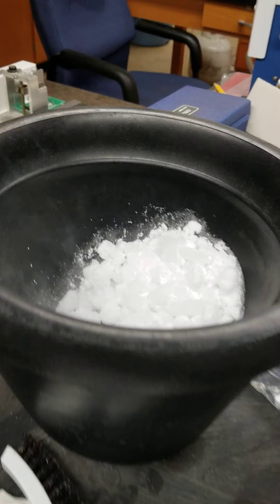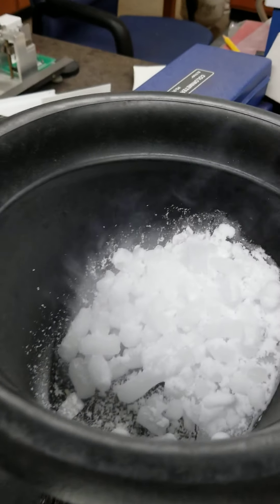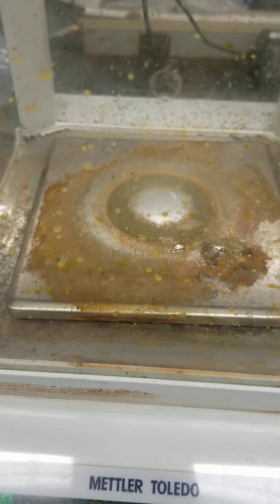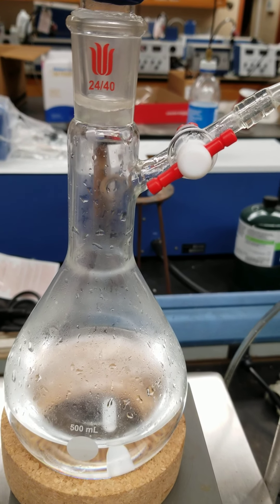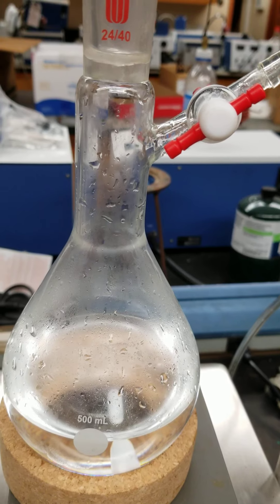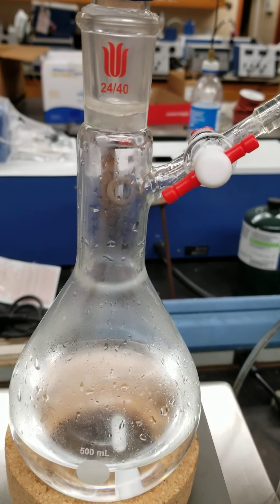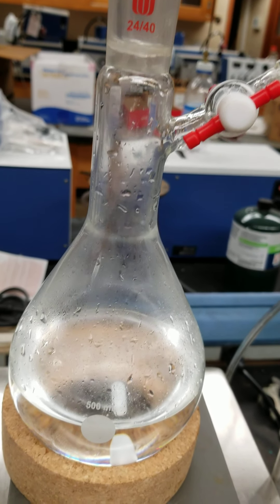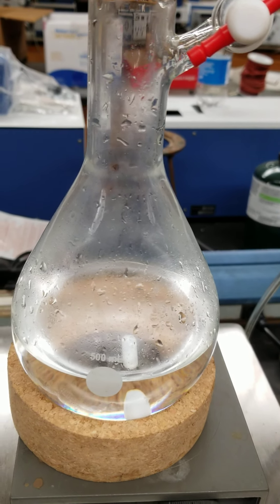So what are the things to think about? The balance — when you weigh the stuff, what happens? First, of course, the purity issue with water absorption; the balance with the weight decreasing, although I rapidly put it in as quickly as I can. How does that affect the values of P-CO2, the pressure of CO2 that we measure? I'll ask you to consider these things as you process the results. If you've done the pre-lab, then you've done all the programming necessary to do the calculations — all you need to do is put in the relevant data. Happy day, my friends. Bye-bye.